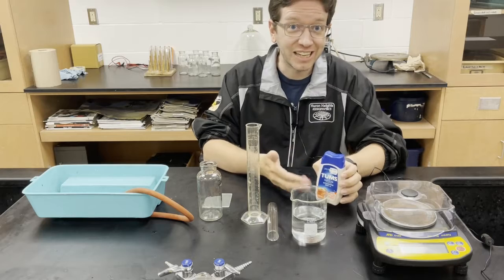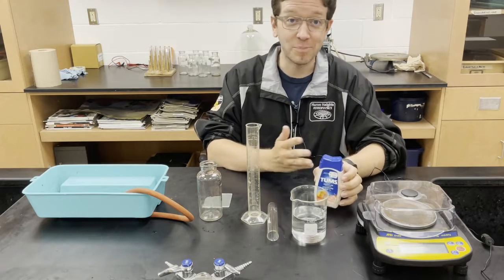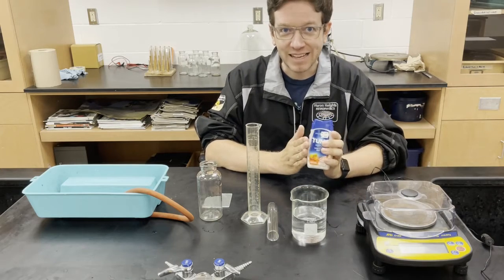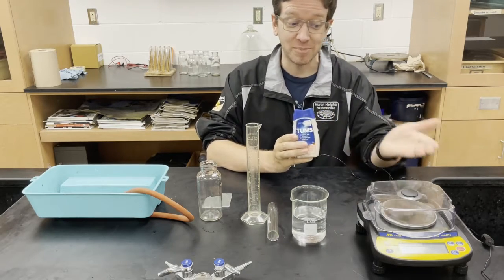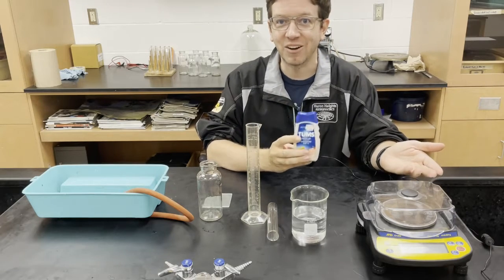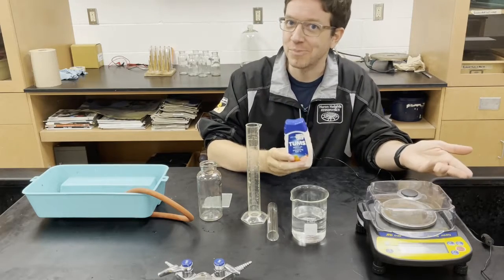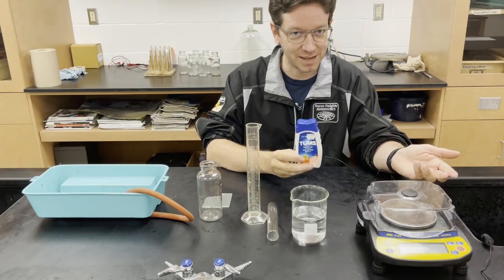Now if we can collect and measure the volume of this gas, we can work backwards with some stoichiometry to figure out the mass of calcium carbonate. And if we know the mass of the Tums tablet to begin with, we can find out how much of Tums is made of calcium carbonate — the percent composition of calcium carbonate in each Tums tablet.